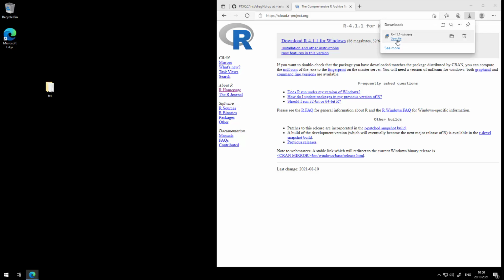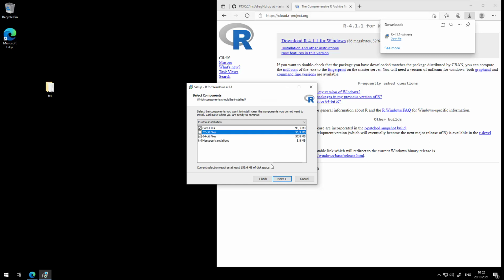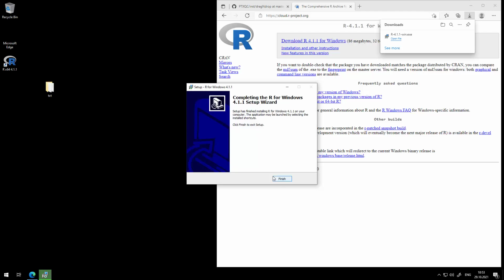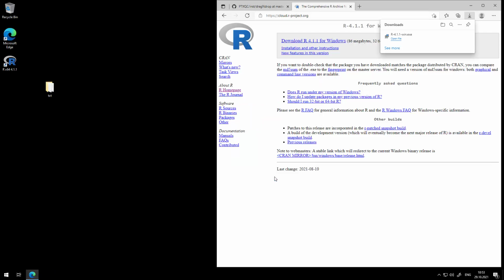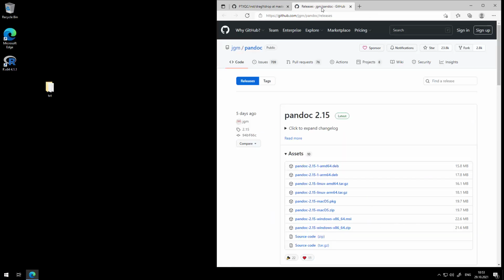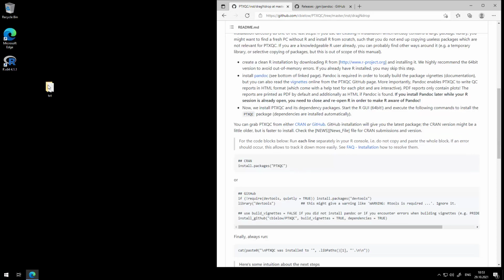These days, if you install these things, both 32 and 64-bit come in the installer. I just deselected 32-bit because you don't want to risk running 32-bit just by accident. Okay, so that was R done, installed. Second thing we need is pandoc, which I'll just open the browser tab for. We're not going to download it yet because we'll do that later. For now, let's open up R.